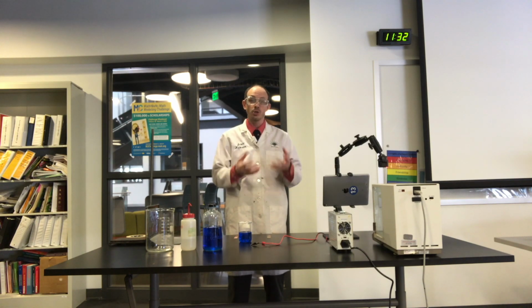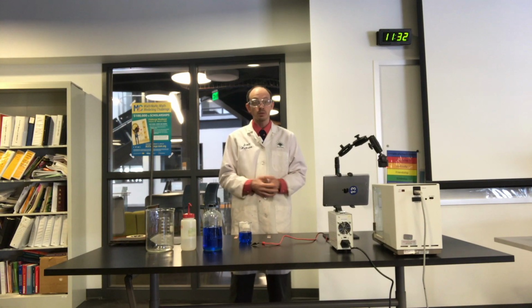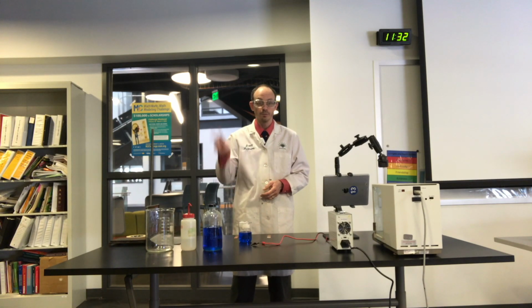You have the initial masses, you have the final masses, you have an average amperage that you're aiming for. You can now calculate coulombs. You guys have everything that you need to be able to tell me the amount of electrons that is transferred and compare that to Avogadro's number. So, see ya.